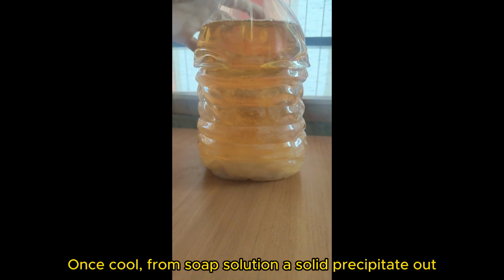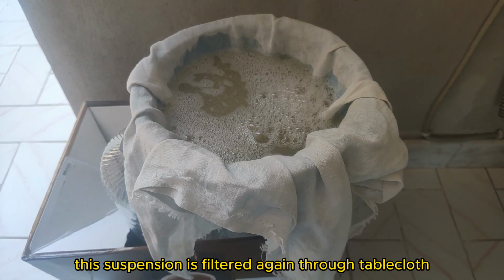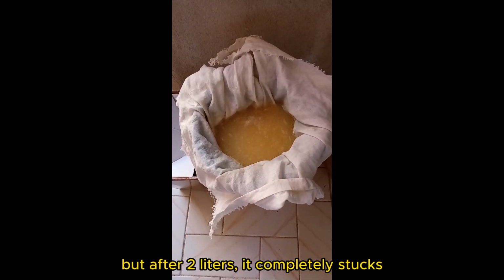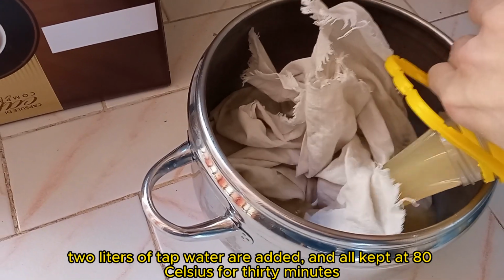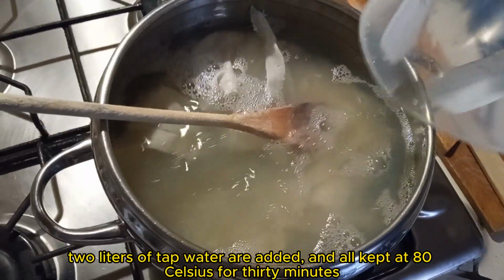Once cool, a solid precipitates out from the soap solution. This suspension is filtered again through tablecloth, but after 2 liters, it completely gets stuck. The tablecloth is placed in the pot, along with the remaining soap suspension. 2 liters of tap water are added, and all is kept at 80 Celsius for 30 minutes.